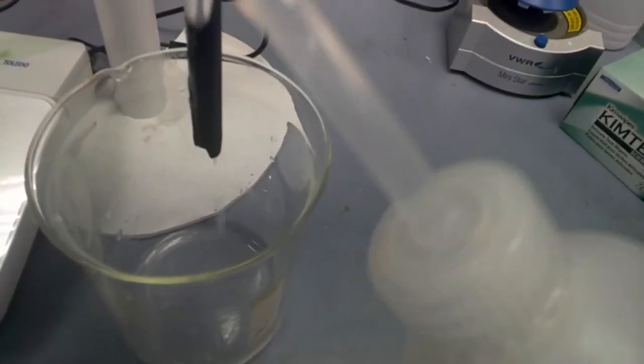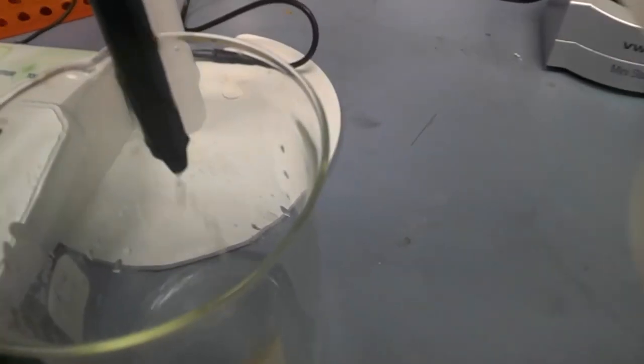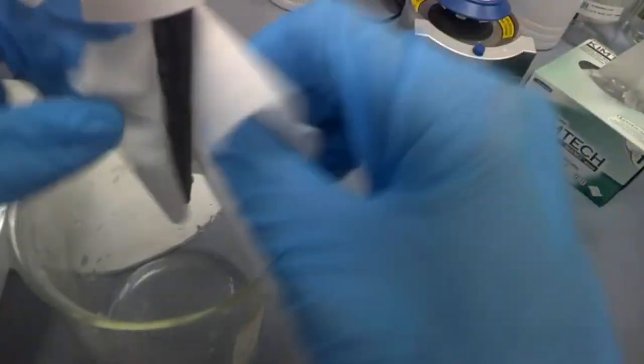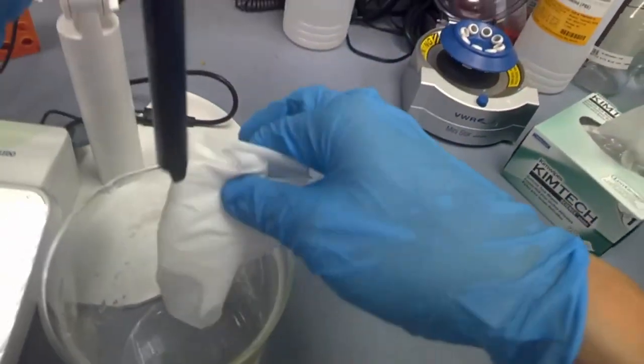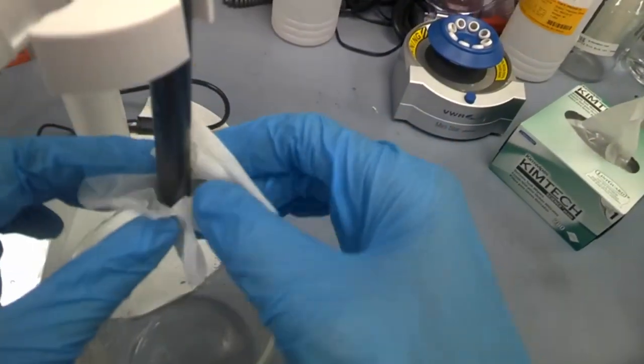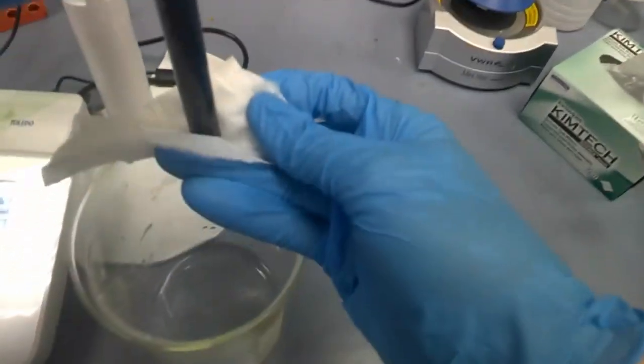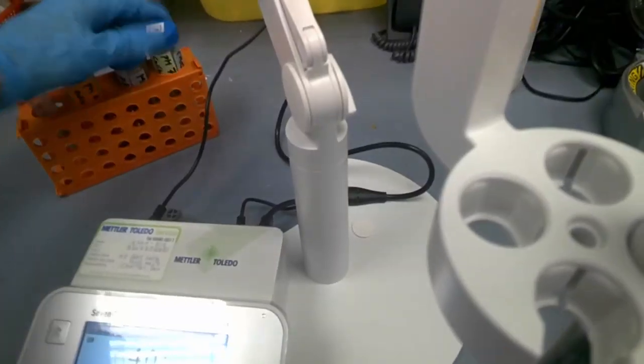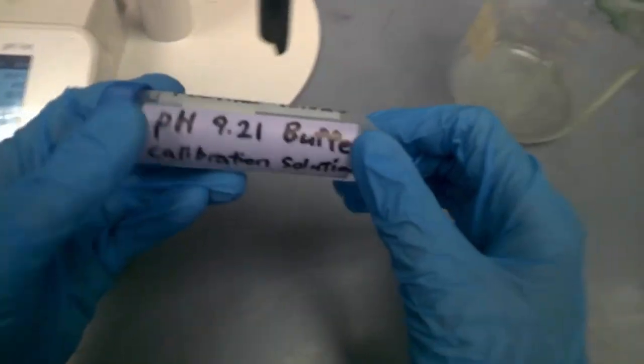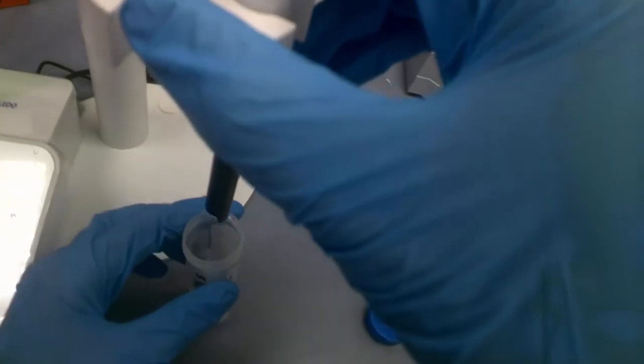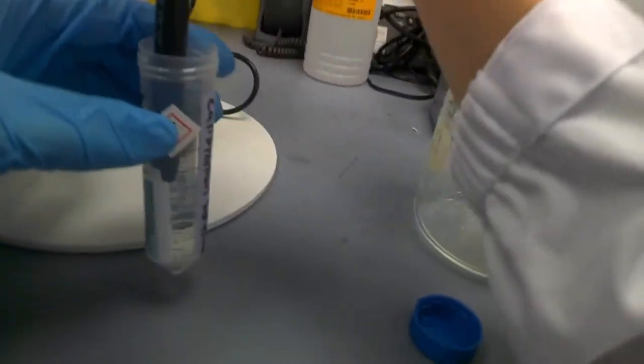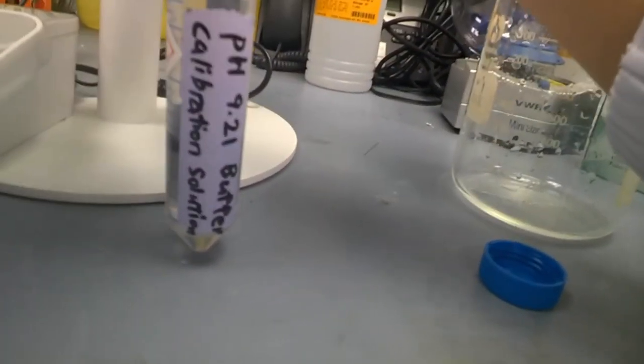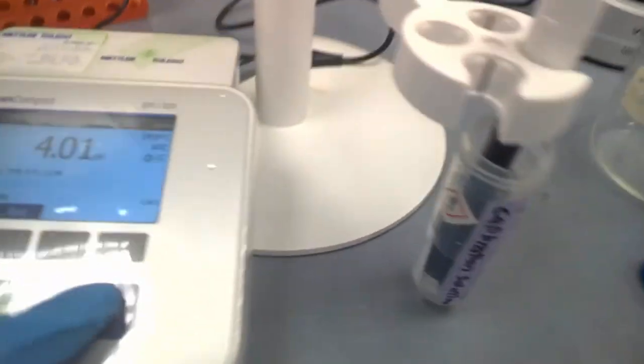So rinse it with the DI water around and on the probe. And then use a kim wipe, folding to half. Wipe. Pull it up if you need space. This pH probe is flexible, the arm is. So be very careful. Be gentle. Good. Next, we pass the last pH calibration, pH 9.21. Open the cap. Push down the arm. And look out for bubbles. There shouldn't be any bubbles here. All the way down. Move your hands away so there's no heat there. And after that, press calibration again.